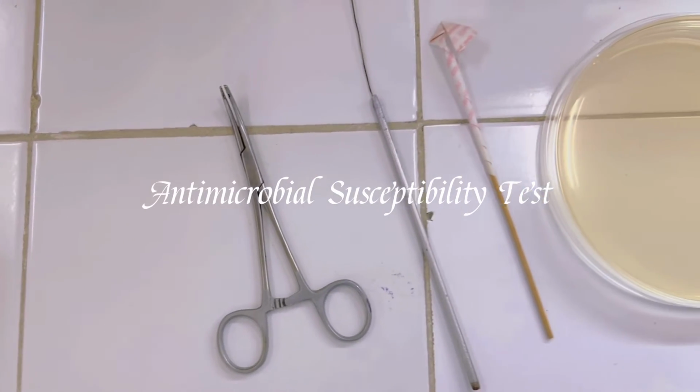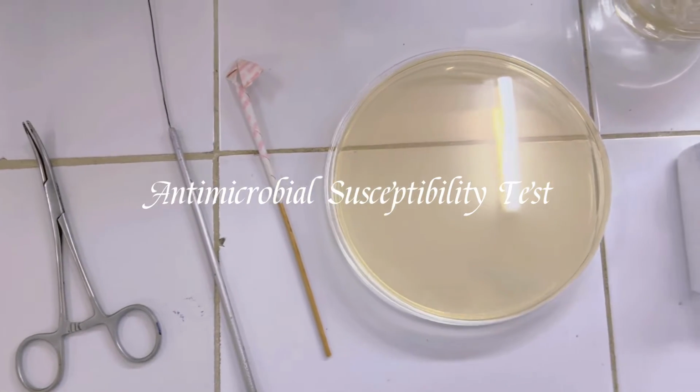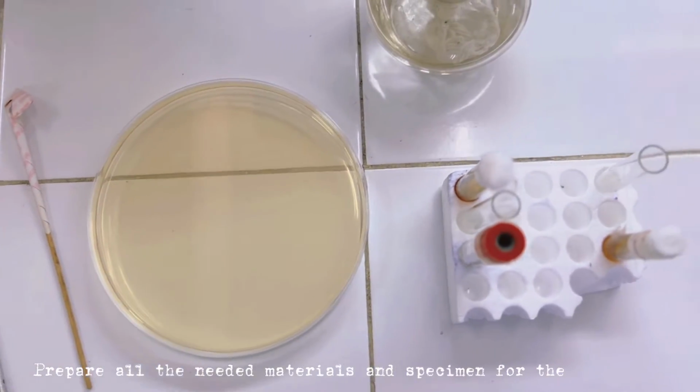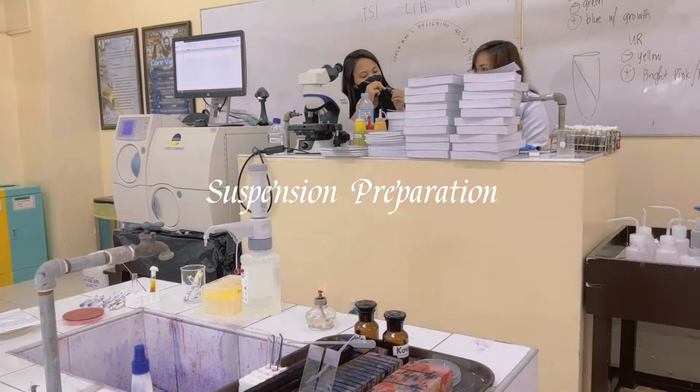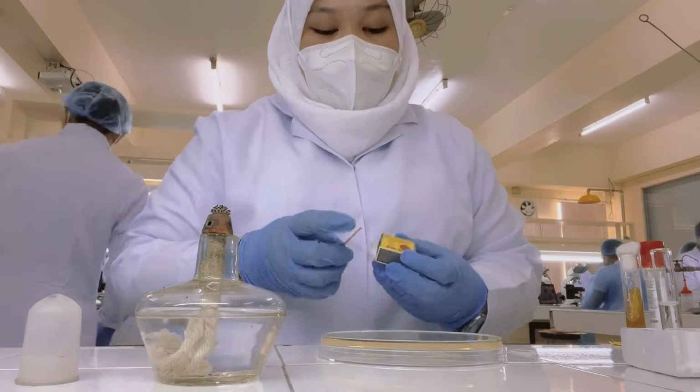Antimicrobial susceptibility test. First is to prepare the suspension by adding 3 ml of NSS to the test tube. Next is to add the bacteria to the test tube.